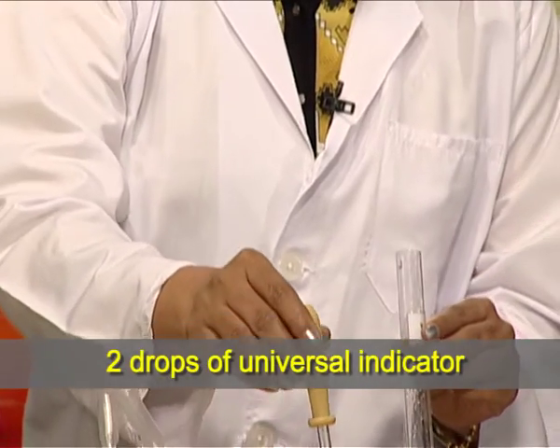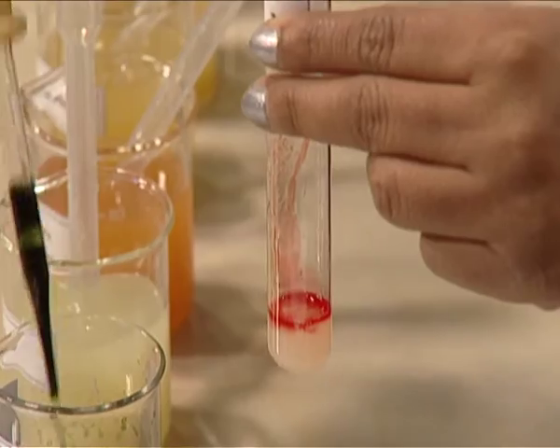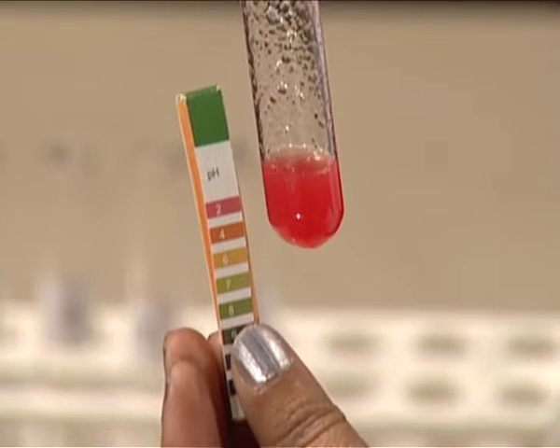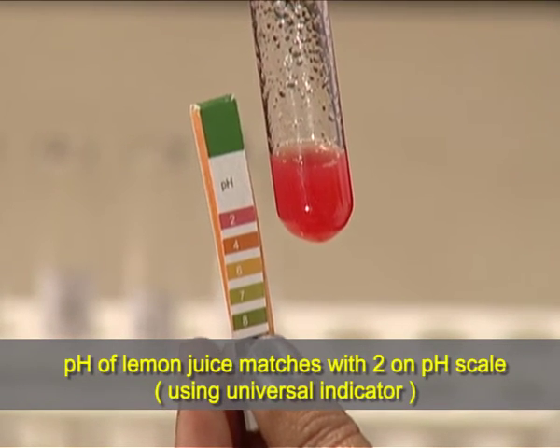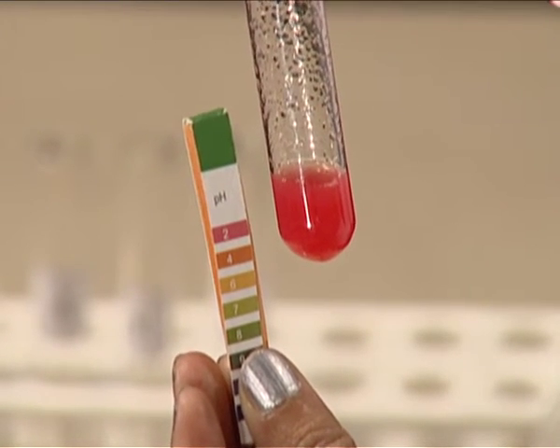Now, I am adding 2 drops of universal indicator. Shake the content of the test tubes thoroughly. Standard pH chart, as you can see, it matches with the pH 2, that is its pH lying between 2 to 3 in case of lemon.